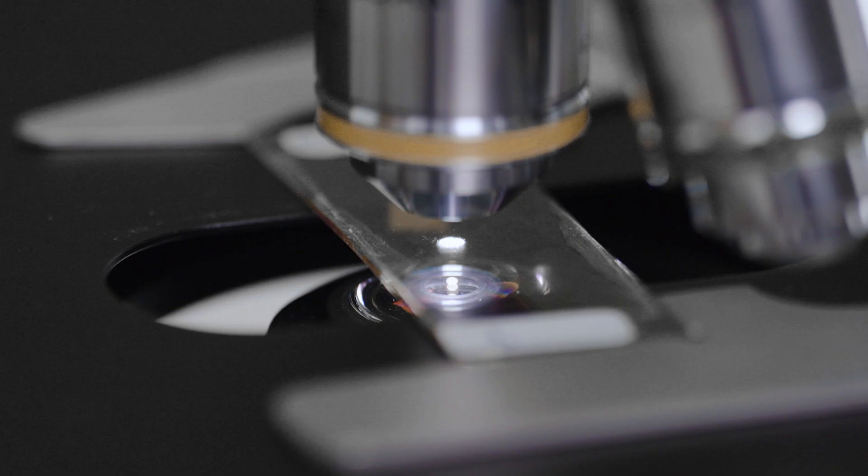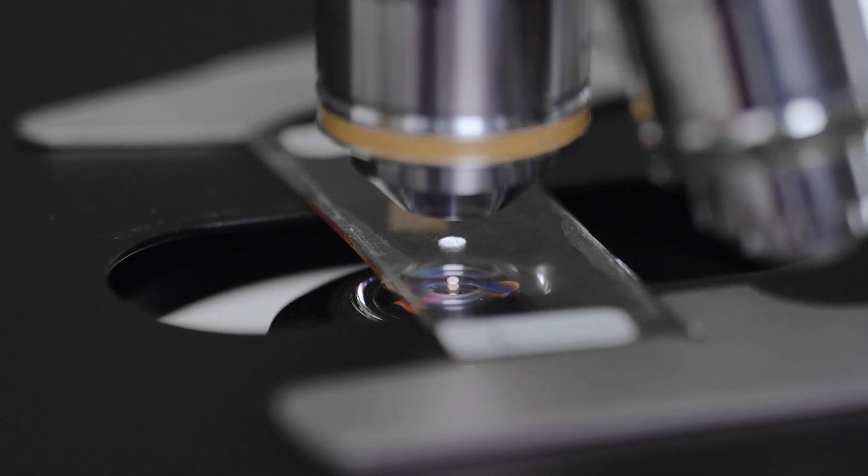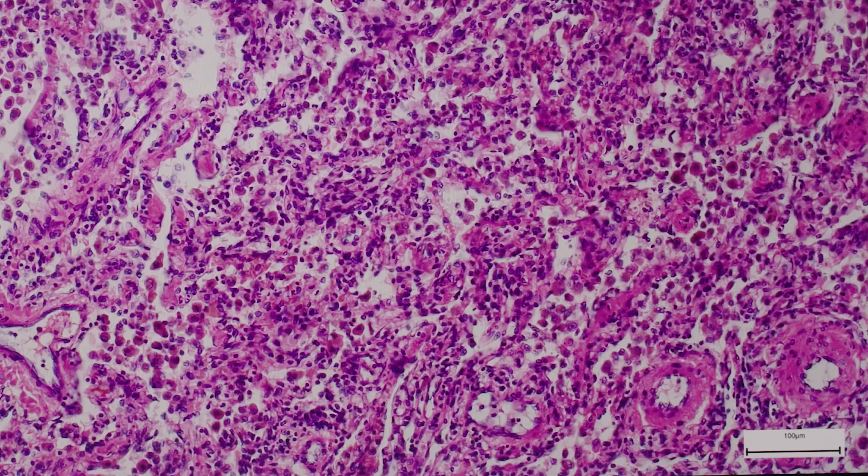Utilize the active light manager for optimal brightness and contrast. This automatically ensures pleasant image brightness for your eyes and clear visibility of your samples under different magnifications without any further light adjustments.